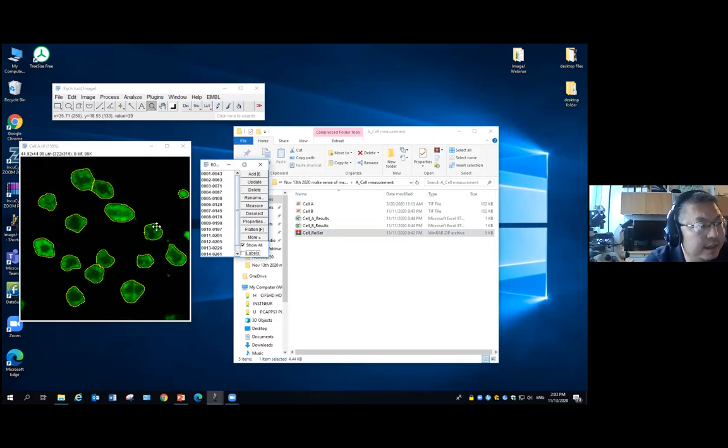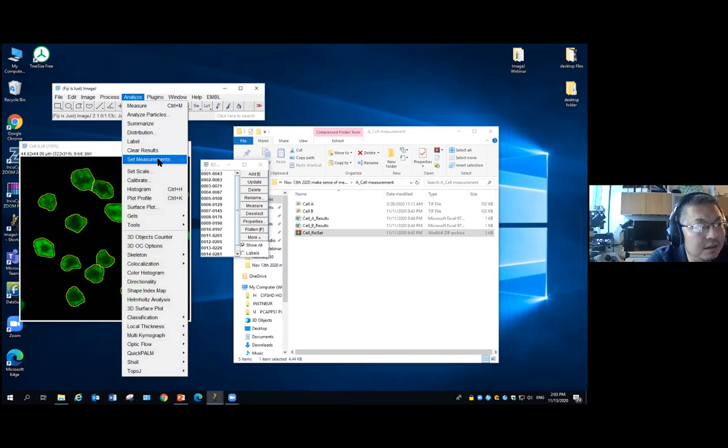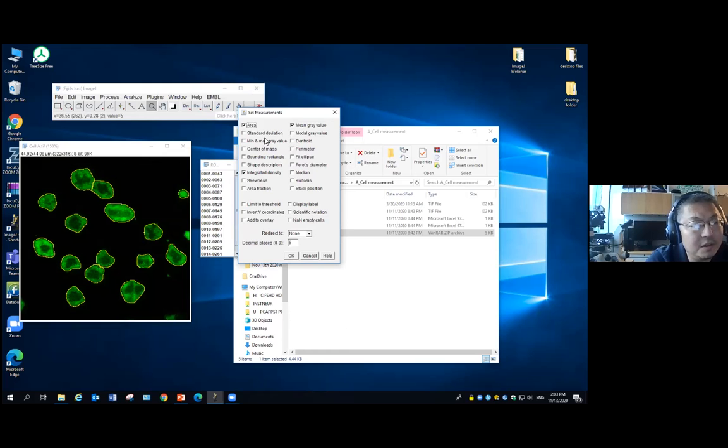So we identify the cells, and now we want to get some measurements from the cells. We want to compare different groups of cells. All the measurements you can do directly from ImageJ. You can select it through the ImageJ main menu, Analyze, Set Measurements. Once you click on this, it gives you this box. Basically, all the measurements are built into ImageJ. If you want to do anything other than this, you have to write your own macro code to get the value you need from those parameters.